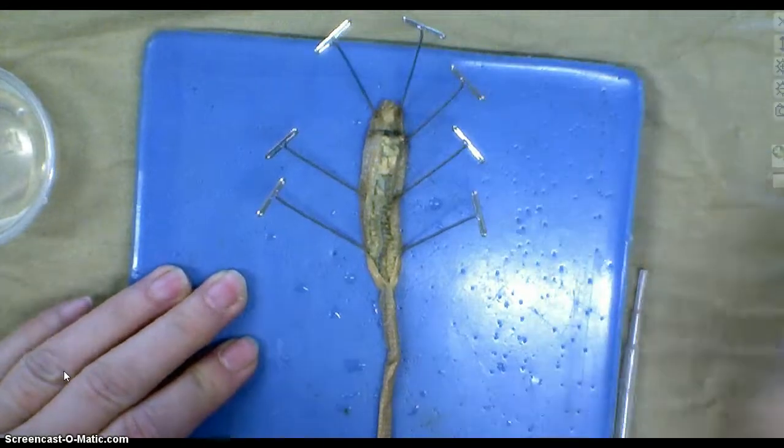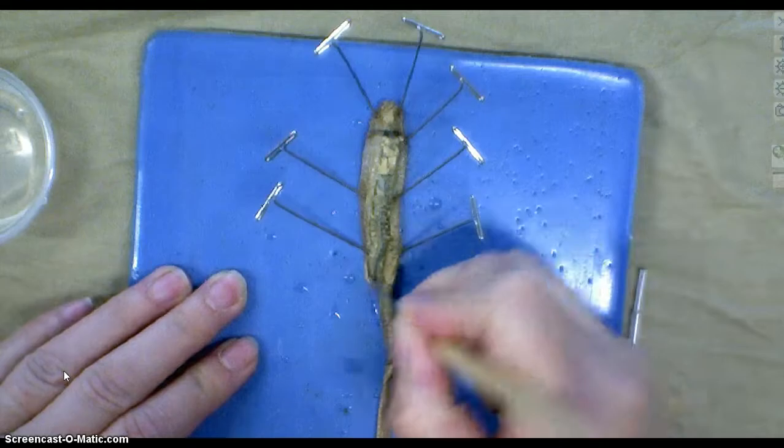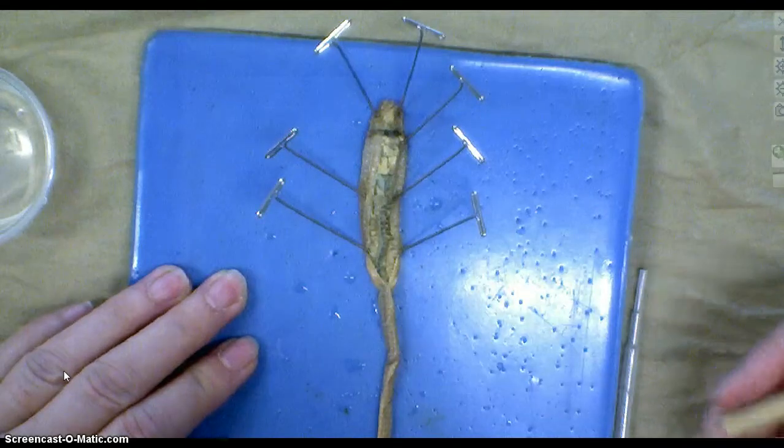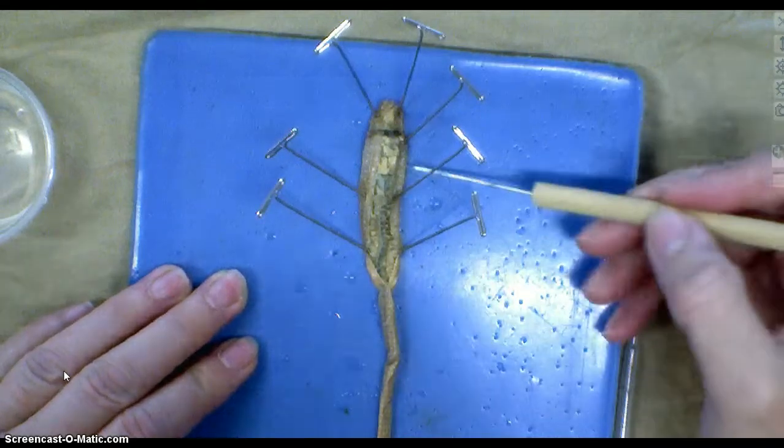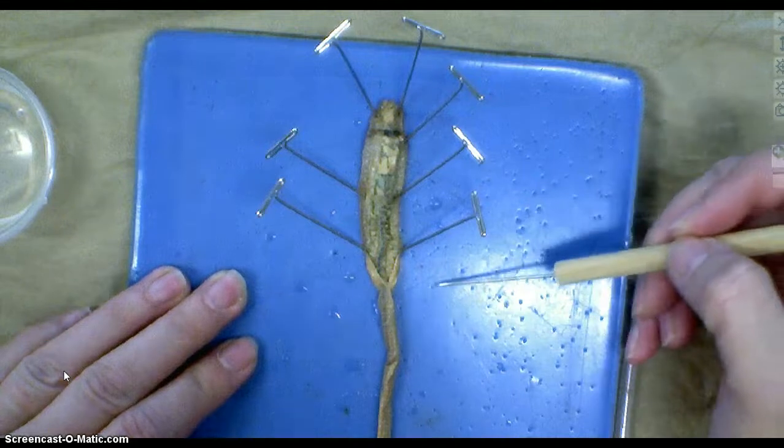That is how you open up an earthworm so that you are ready to understand all its parts and how it's put together.